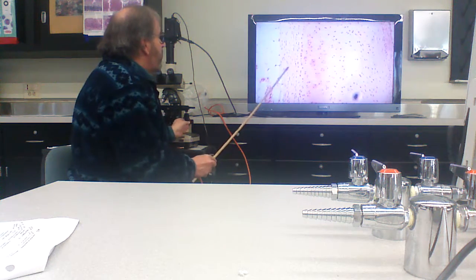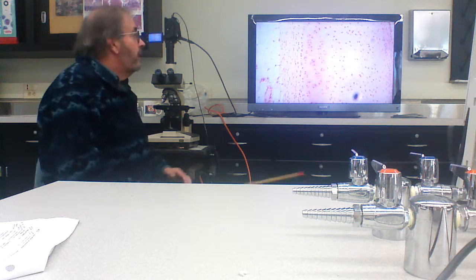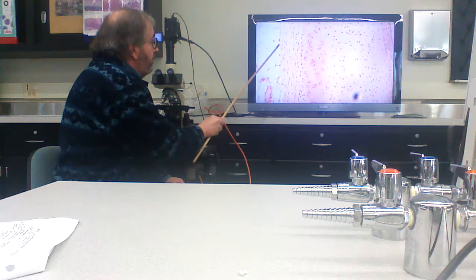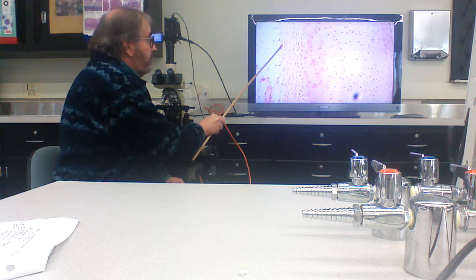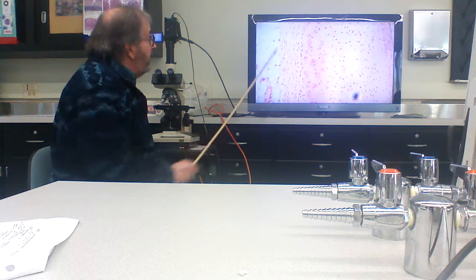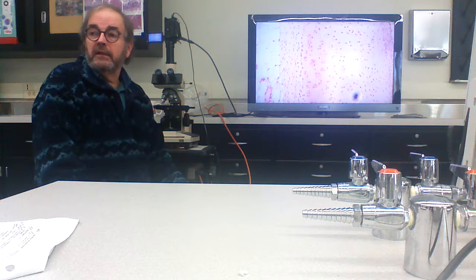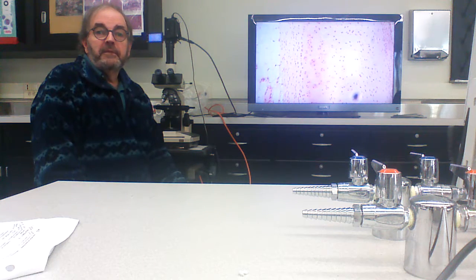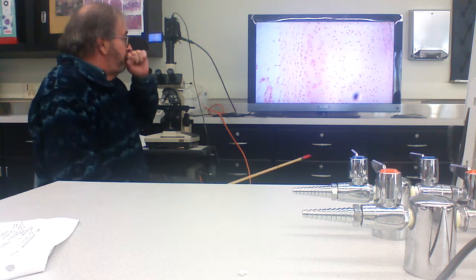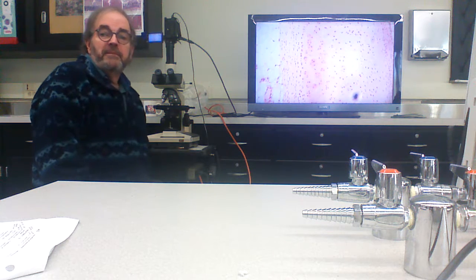Okay? These cells then further differentiate. And, right? So this is the fibrous area on the periphery. It's the fibrous area of the perichondrium. And on the inside of that, you have what's called the chondrogenic area. And chondro is the word that applies to cartilage, right?